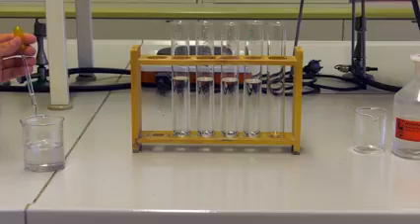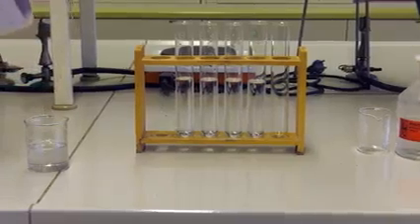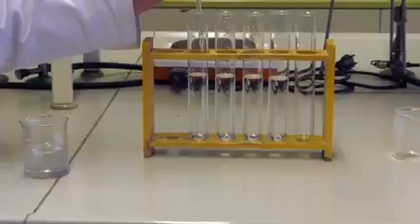First, we dissolve the sodium chloride, sodium bromide, and sodium iodide with water in test tubes. Then, we add silver nitrate to each solution.